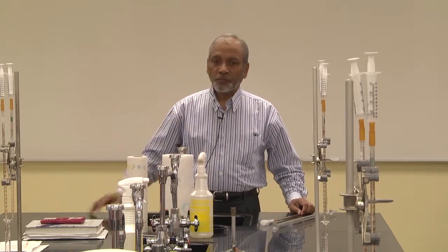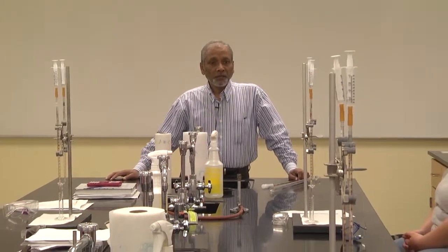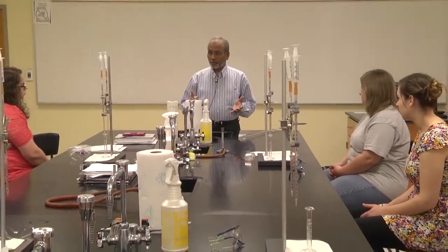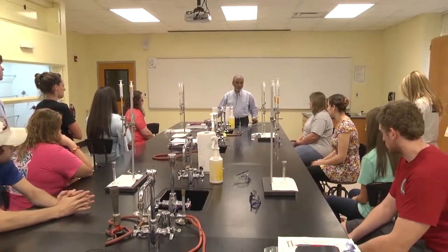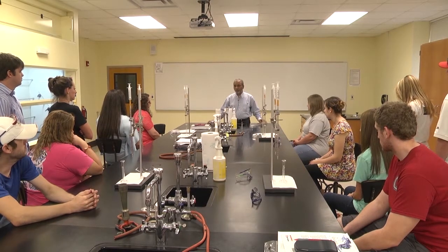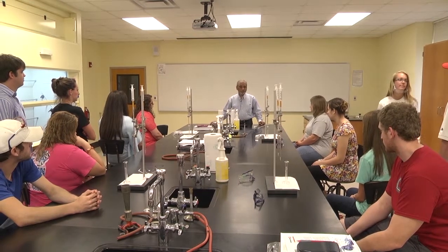So once you calculate the molarity of acetic acid in vinegar, then you will convert it into percent by mass of acetic acid in vinegar. Now, the commercial vinegar, whatever vinegar we use, on the label it says 5%. So that means the vinegar is 5% acetic acid. So you are going to calculate the percent from your calculations, and then you will compare, and you will see whether you get 5% or you get more or less. So you will compare your result with what they are saying, that it is 5%. Okay? All right, any question? Okay, so let's go ahead and start the experiment.